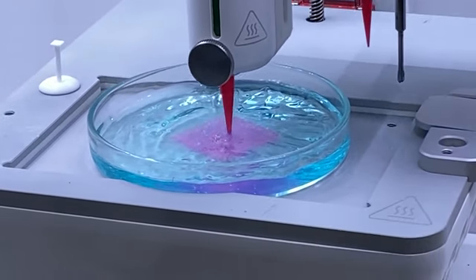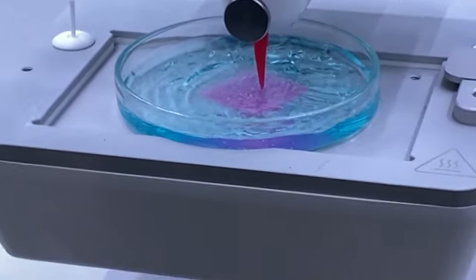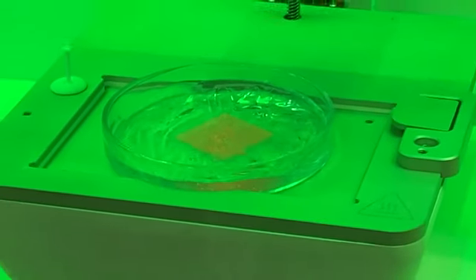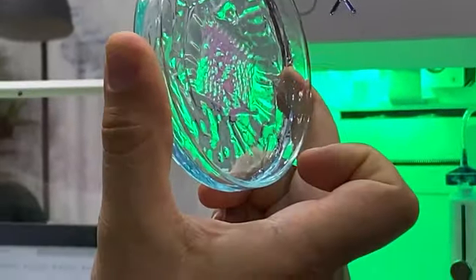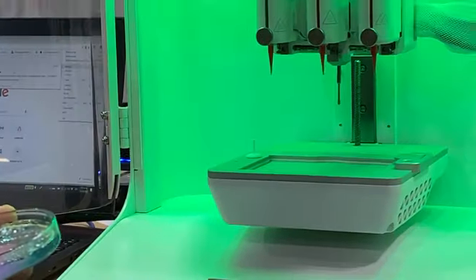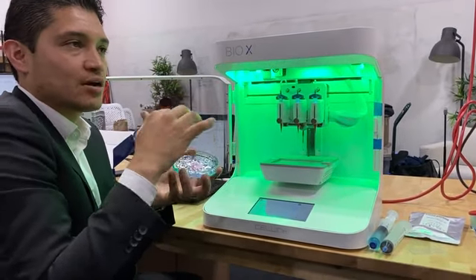Sorry, as I printed before, it's not going to be pretty clear what is printing. But the most important is to show you that you can print with different biomaterials. So it barely shows that, but the previous printing, you can see the previous printing here, right? Yeah, as you can print on the top of one support material, you can print on the top of one petri dish without support material.